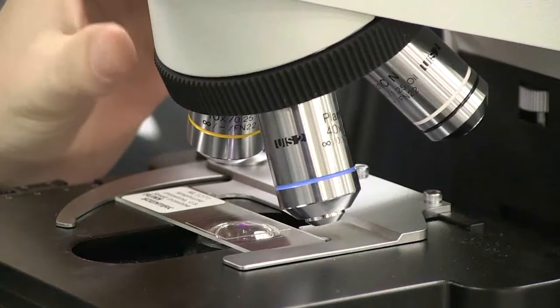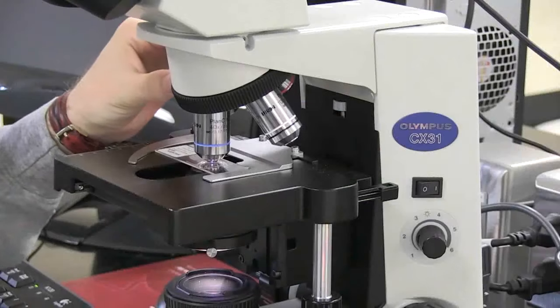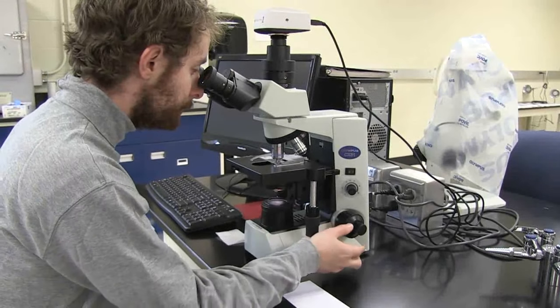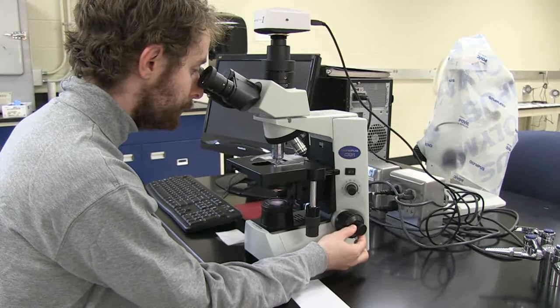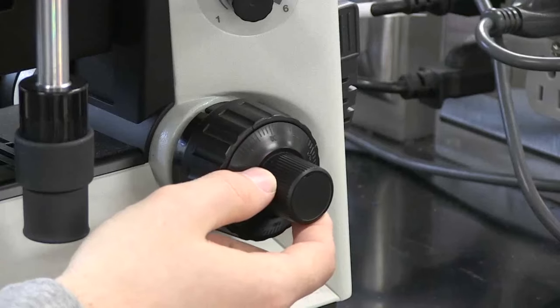To see your specimen at a higher magnification, turn to the 40x objective. Using only the fine focus adjustment, focus until the image becomes clear.